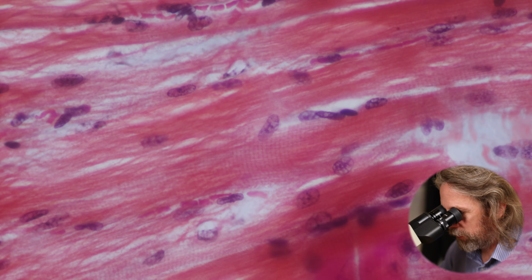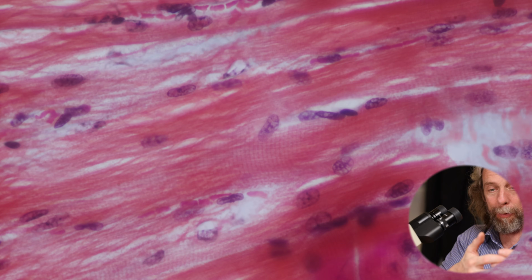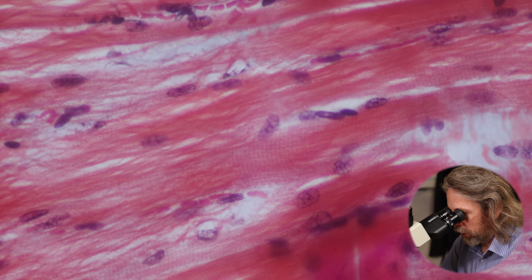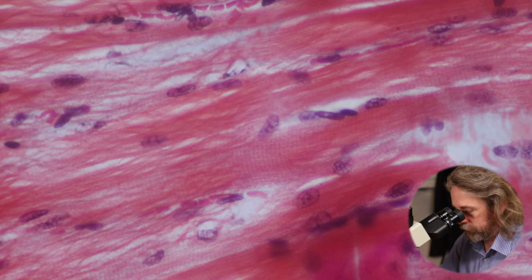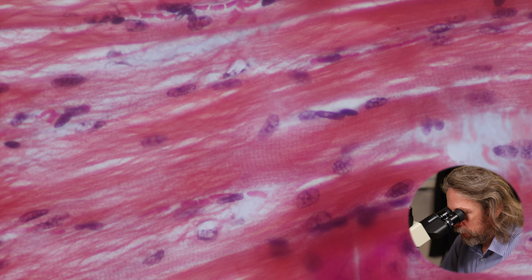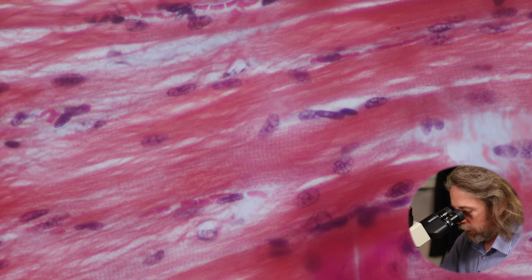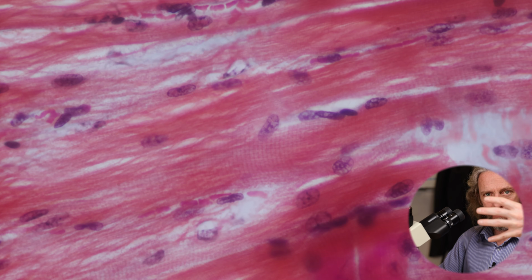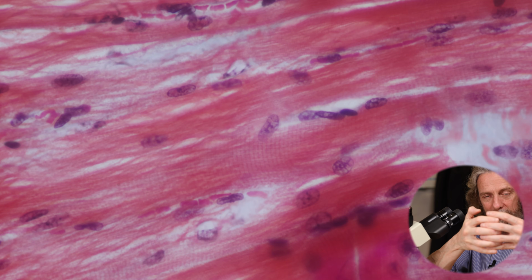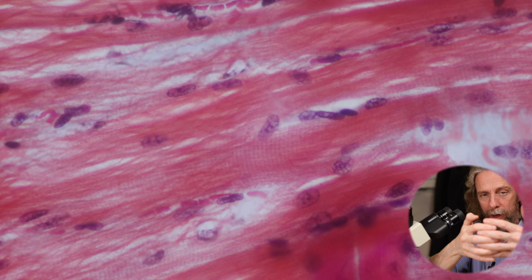And where those thick and thin filaments overlap, that's where we see the banding. So the actin and myosin filaments are about 10 nanometers thick. To show you those, I'd need an electron microscope, which would be a much longer afternoon and probably less interesting for you. But where we just have thin filaments, that's the light band. Where the thick filaments then overlap with the thin filaments, that's where we see the dark band.